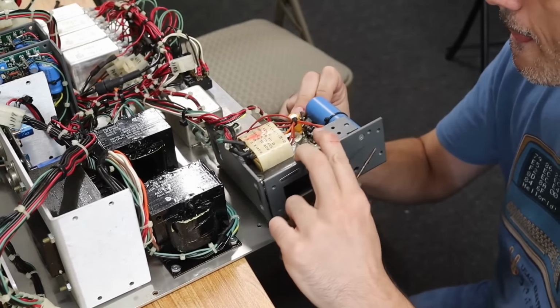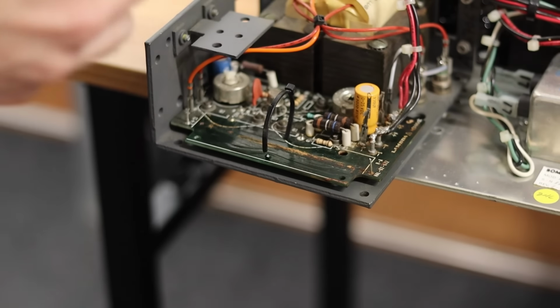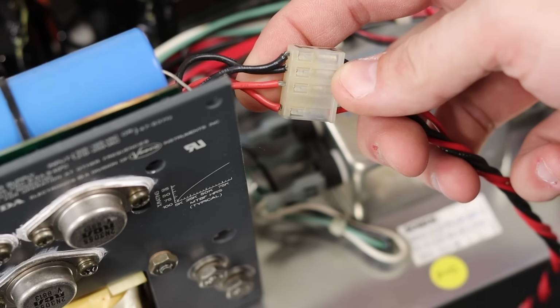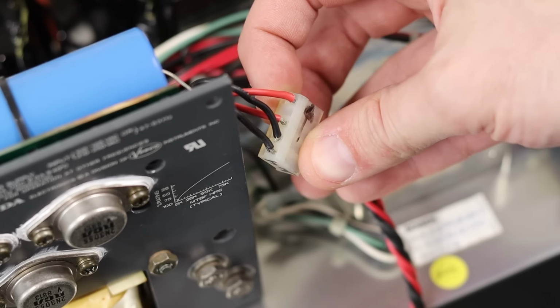Looking back at my previous footage, we had a 5-volt 6-amp power supply go bad. This supplied 5 volts to the computer, but also there was a long cable soldered to it that I had no clue where it went. Well, now I know. It was power for the communication board up top.